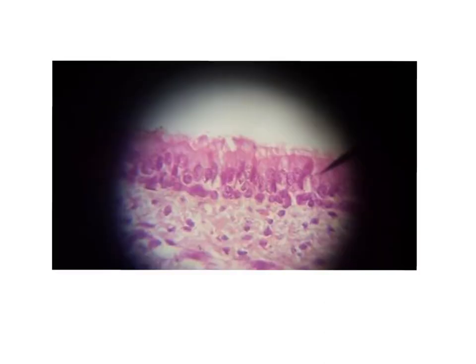Another slide for the epithelium in high power is the pseudo-stratified columnar ciliated epithelium with goblet cell. Here we have two rows of nuclei. This is a basal row and another one above it. Then we have this red area representing the cytoplasm of the tall columnar cell.